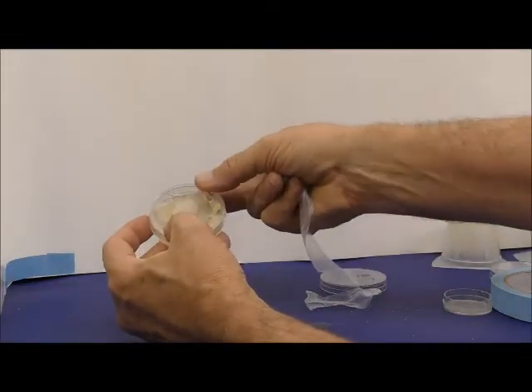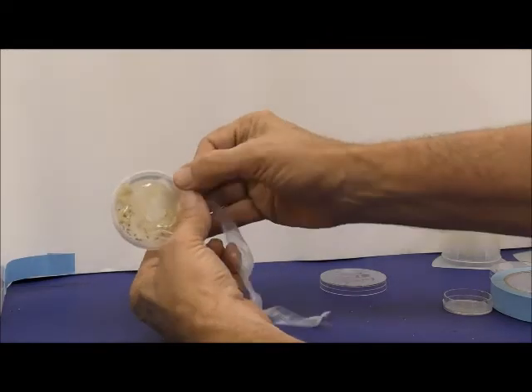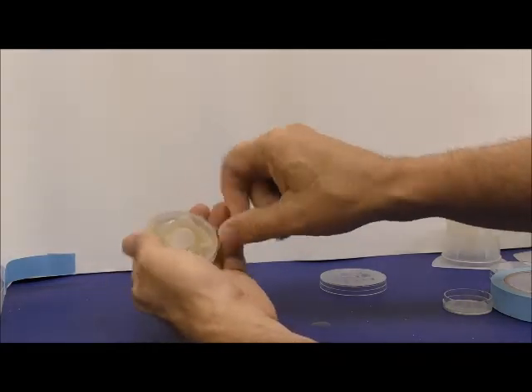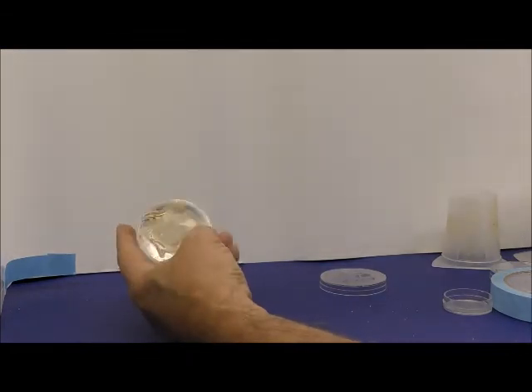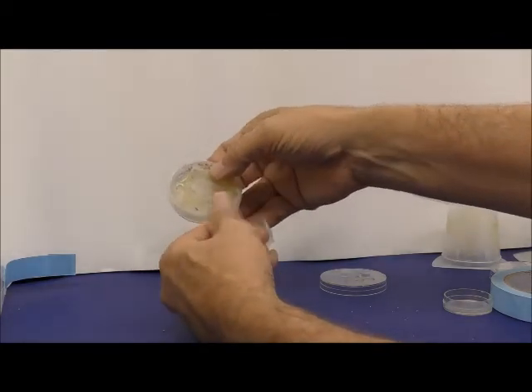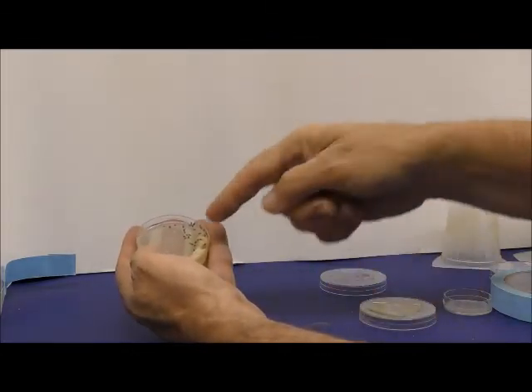And if you're going to let them go for 2 or 3 days, you might even put parafilm or saran wrap around the edge, and it does keep the moisture in there from them drying out. Again, if it gets a little bit too dry, you can add water right through the screen. So this is one way to put some tape on here, and then mark the time you collected them, and now you'll have your egg pulses at a certain stage. So this is one way to utilize and collect eggs, and then get your first instars off.